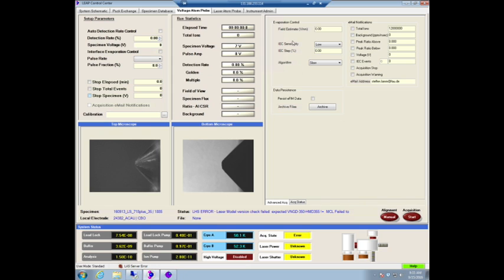So this is your operations tab for the voltage atom probe, and we're going to get into that in a minute. But before we can start, we actually need the cryos to be at temperature. We want it to be at 50K, and then we'll still wait for a little bit, simply because of thermal drift, because the diode measures the temperature as close to where the experiment is happening as possible, but the rest of your stage might still need a little bit more time to adjust to the new temperature.